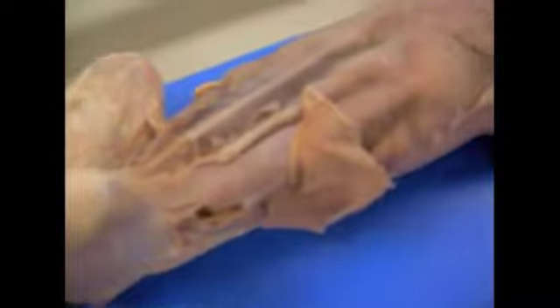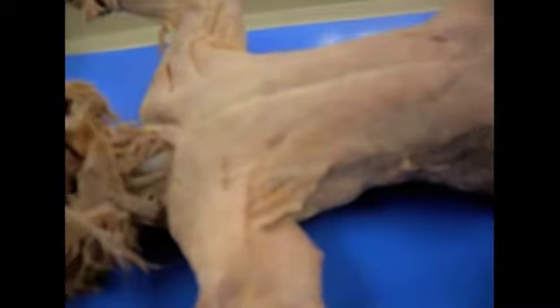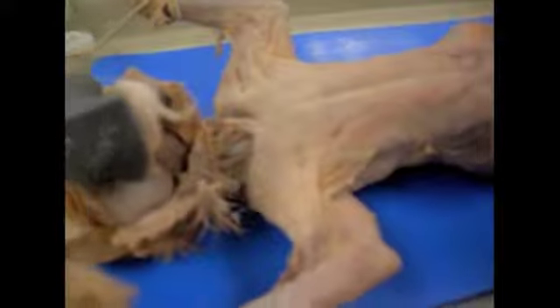Now we will close with checkpoint 3, which is the head and neck muscles. This is the sternomastoid. This muscle originates on the manubrium of the sternum and inserts on the mastoid process, and its function is to rotate and lower the head. The masseter is the large cheek muscle right here on the cat, which originates on the zygomatic arch and inserts on the mandible, and its function is to elevate the mandible.